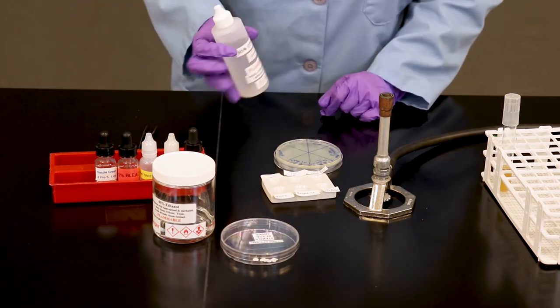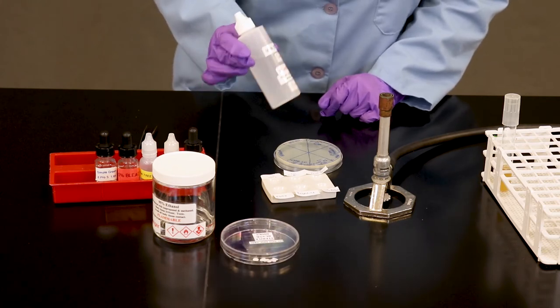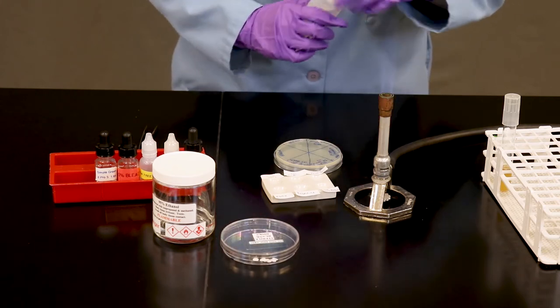Notice I have already pre-labeled my ceramic dish to represent all six of those chemicals here. I'm now going to drop a couple of droplets worth of each chemical into the appropriately labeled well.